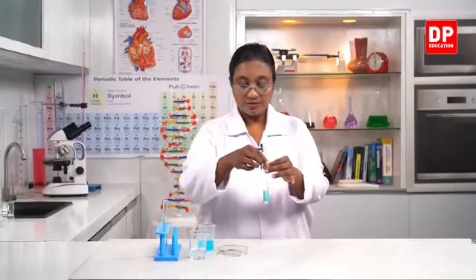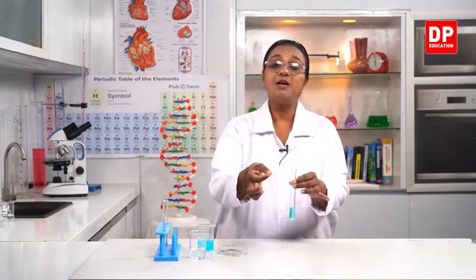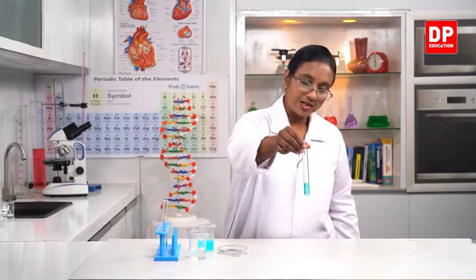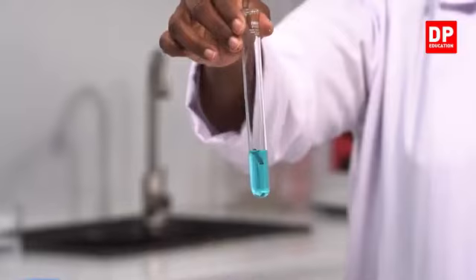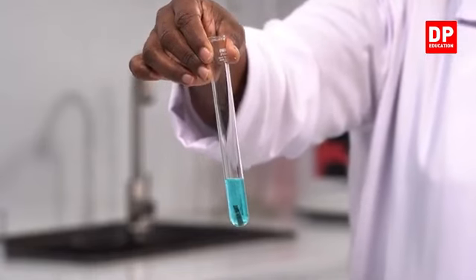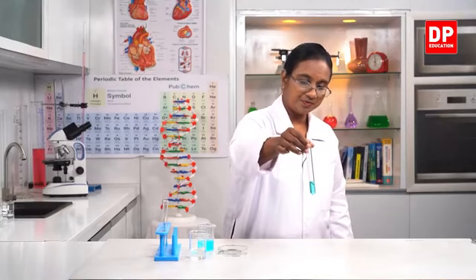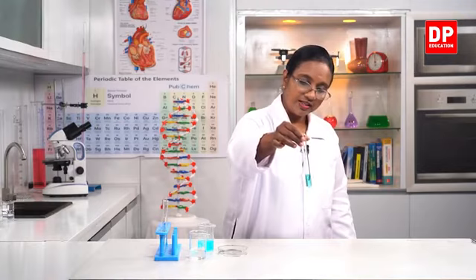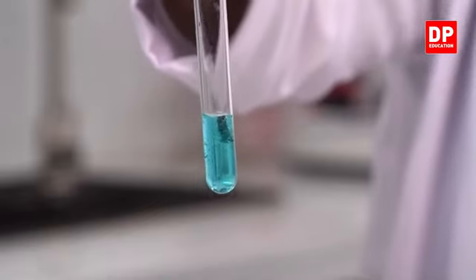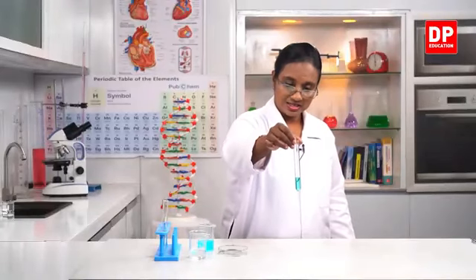For the first one, what I will do is, into this copper sulfate solution, I will put a clean magnesium strip. We will observe what happens there. So when I put that, can you all see the reaction taking place? There, copper sulfate reacts with magnesium strip. So that is how you can observe the reaction, and you can see some solids going down and depositing at the bottom. So that is the reaction between magnesium and copper sulfate.